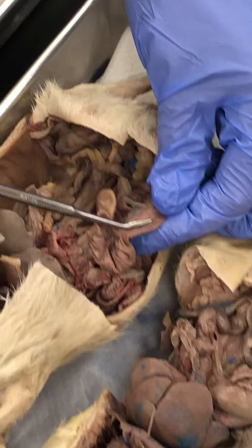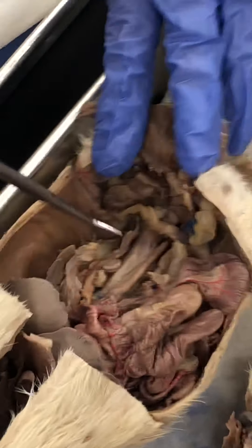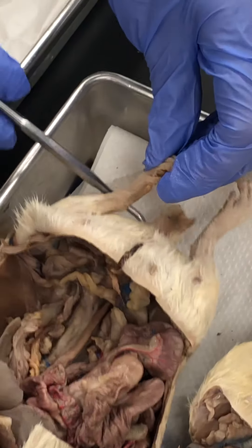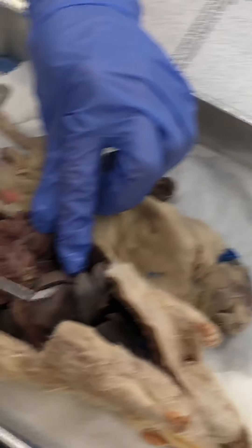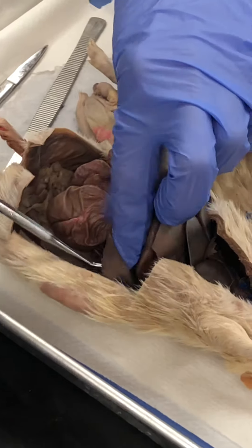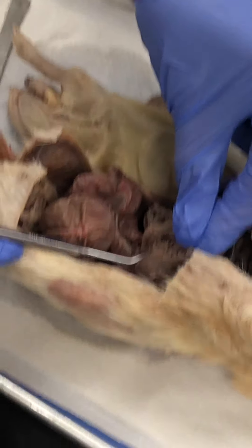Here's your cecum. Then this is the large intestine or the colon — either name is fine. Here's the rectum, and right above the tail there's the anus. You have to know the liver — it's an accessory digestive gland and food doesn't pass through it. You also have to know the pancreas, which is hanging underneath the spleen.